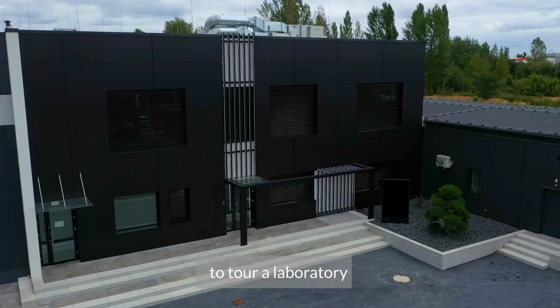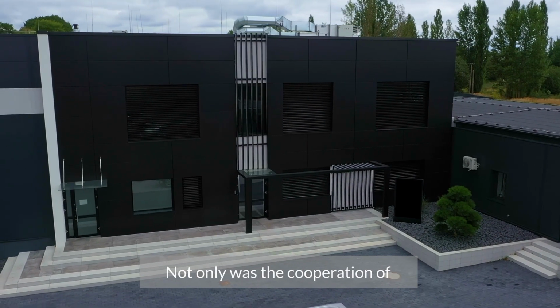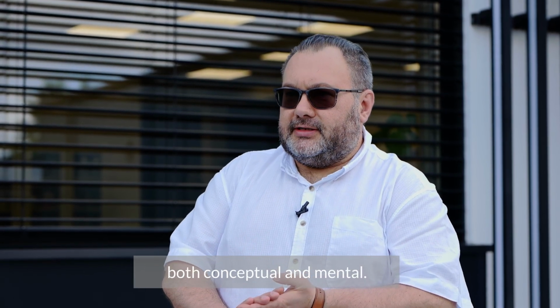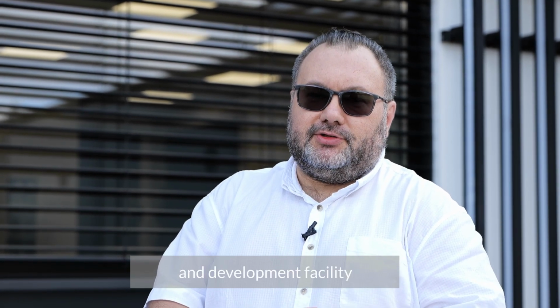And welcome. Today, I would like to invite you to tour a laboratory established in Piotrków Trybunalski thanks to the cooperation of three entities. Not only was the cooperation of financial nature, but also, most importantly, both conceptual and mental. The laboratory, which you will see in a moment, is strictly a research and development facility, and I would like to show you briefly its amazing potential.